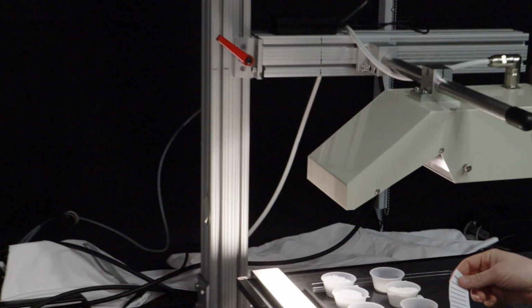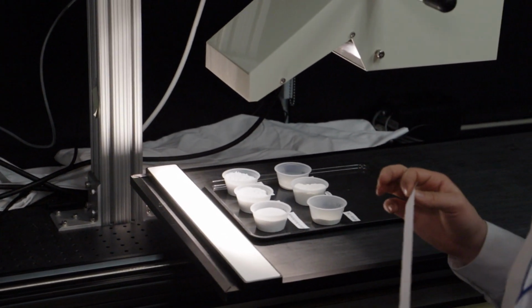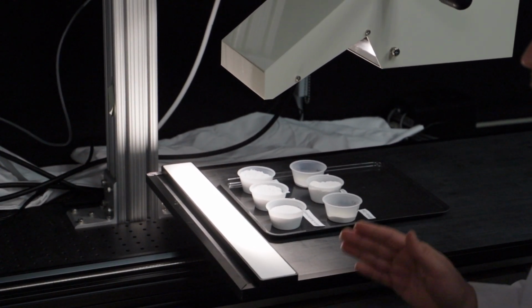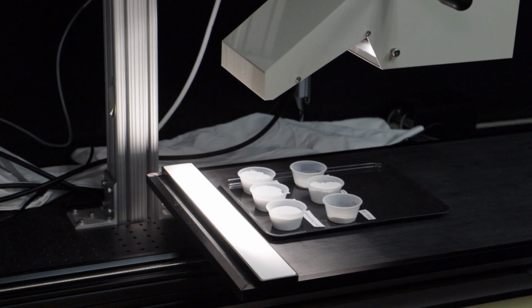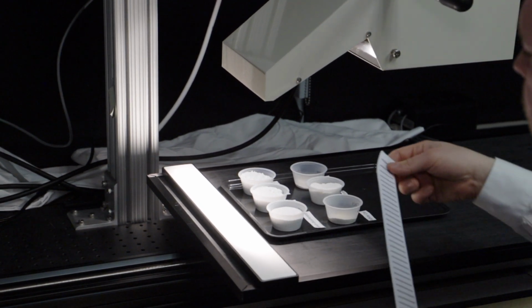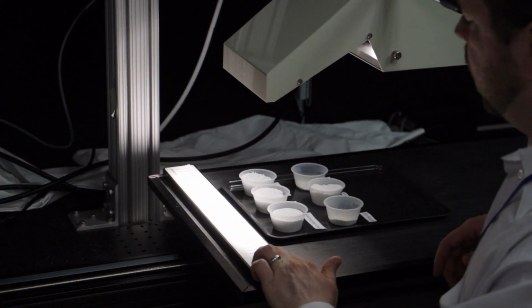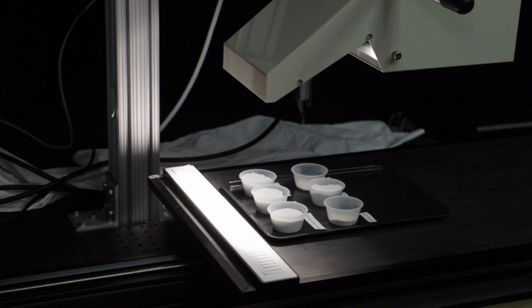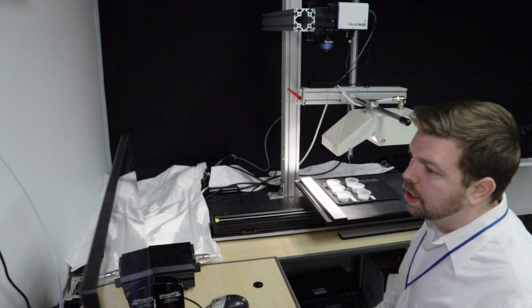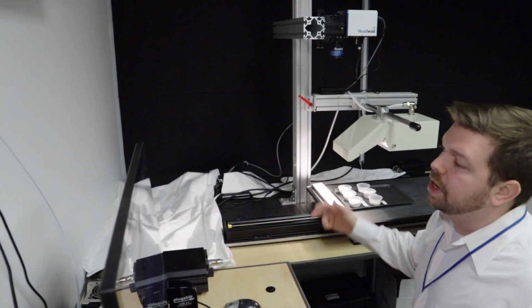And so now one important thing, because this is a line scanning system, is that we want to properly set our scan speed such that every time the stage moves one spatial pixel, we collect a new frame, so we acquire square pixels in the image. And we can do that automatically by, again, placing our handy focusing target in the view of the sensor. And this focusing target has lines spaced by exactly 1 centimeter.